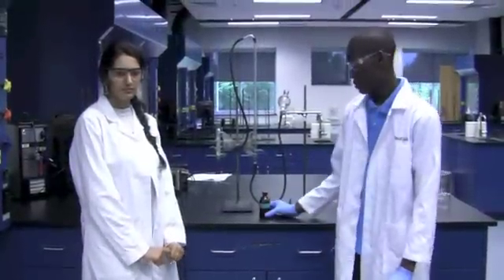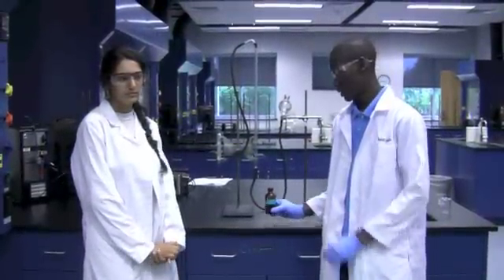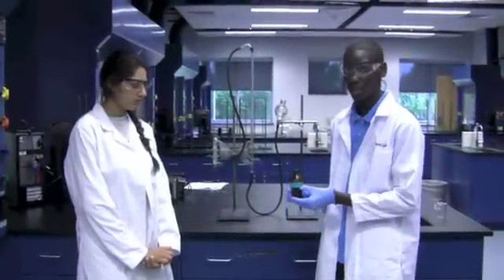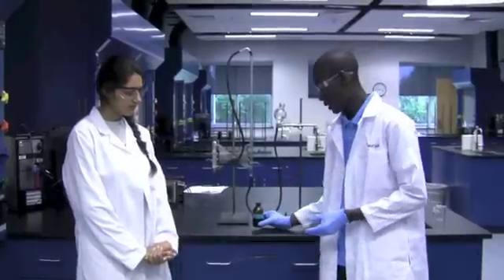You do your experiment twice. After that, you're going to take your unknown sample. Be sure to record the number in your lab notebook, and then follow the same procedure again, running the experiment twice.